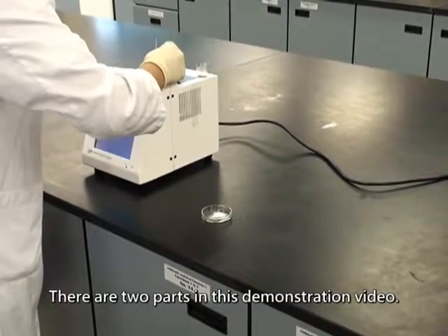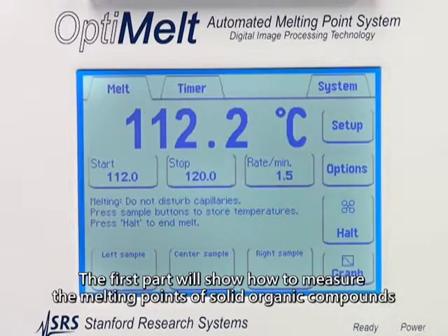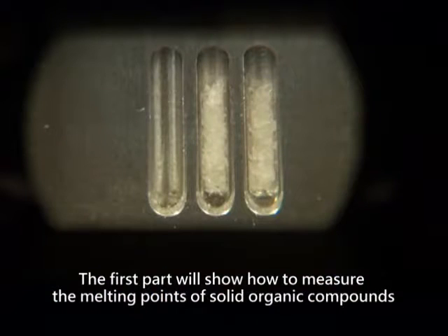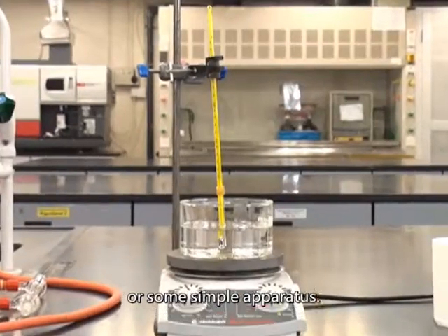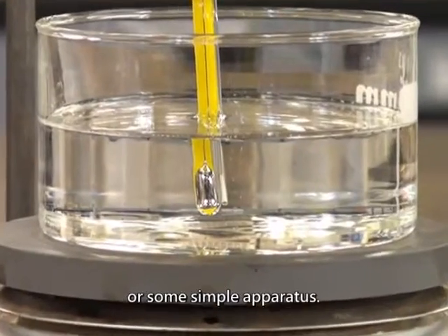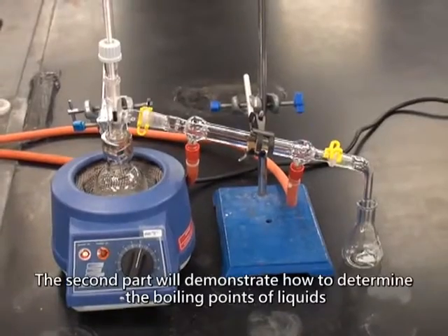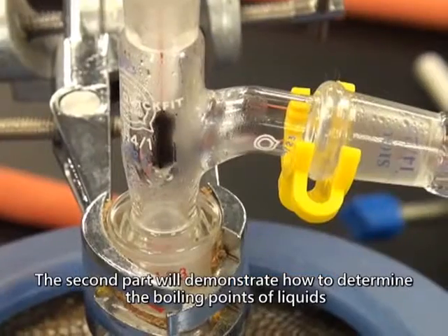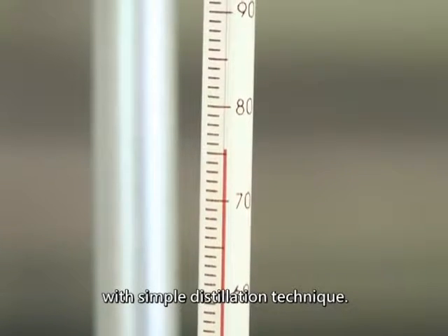There are two parts in this demonstration video. The first part will show how to measure the melting points of solid organic compounds with an electronic melting point apparatus or some simple apparatus. The second part will demonstrate how to determine the boiling points of liquids with simple distillation technique.